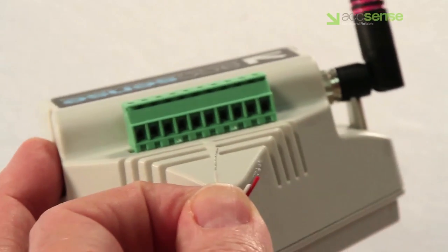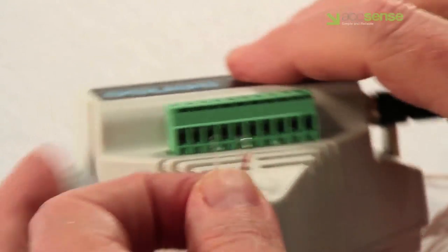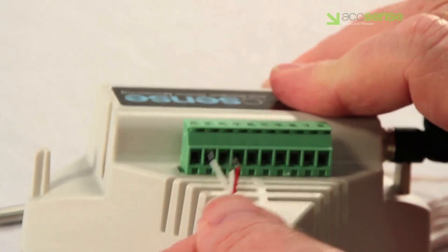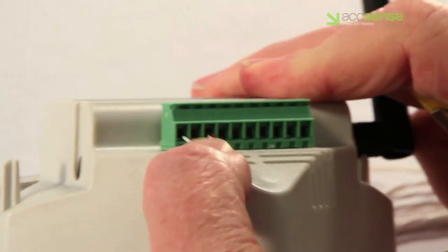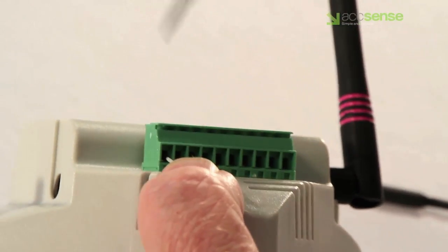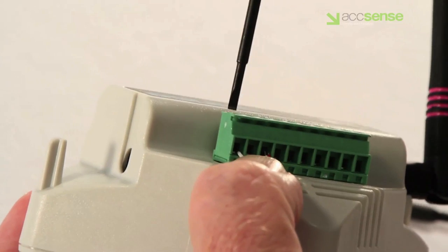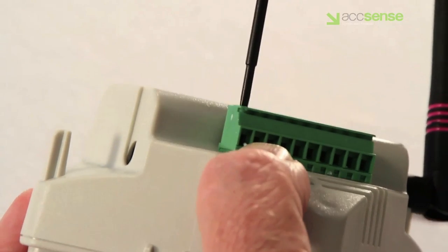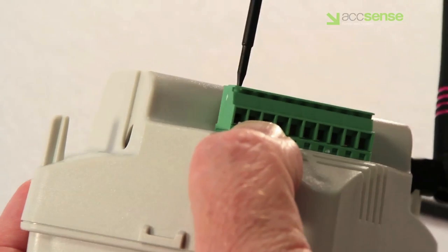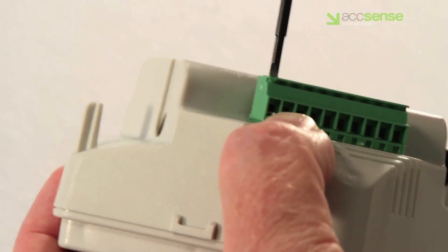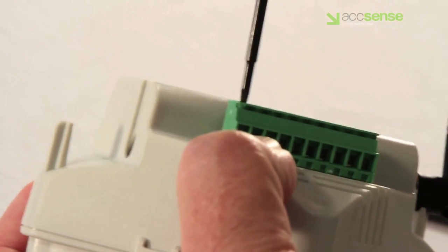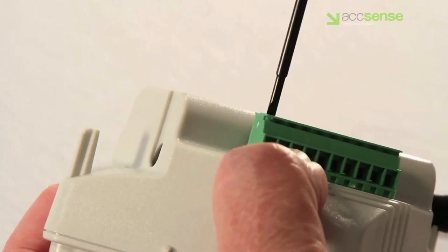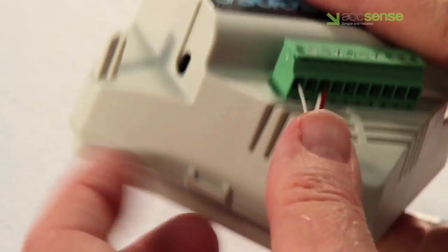Then hold the pod as shown and select either of the common colored probe wires, usually these are the two whites, and they are the positive connections as shown on the card. Insert the wire fully into the cavity below the screw at pin number one, then tighten the screw in a clockwise direction looking down until the connection bar rises up to clamp the wire in place.